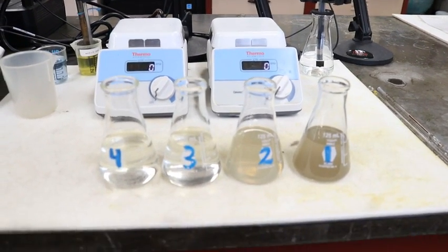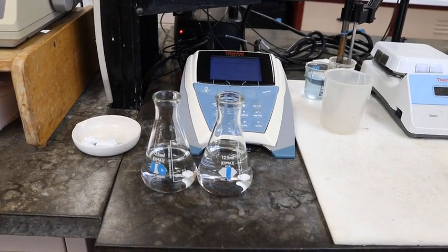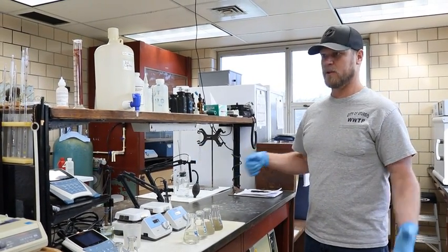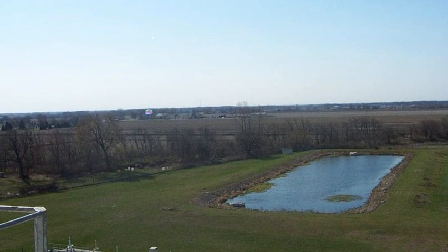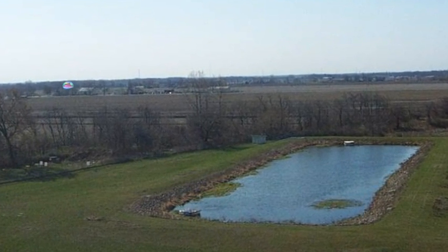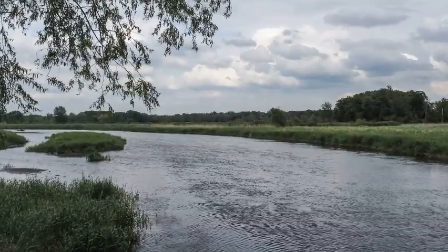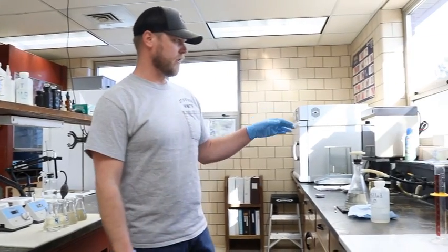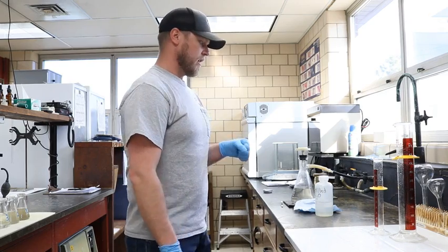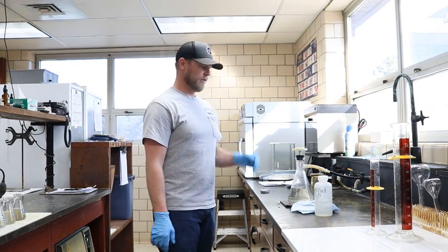In the laboratory itself, we measure pH. We have 2 meters here. We measure pH. We measure ammonia. We measure residual chlorine, which is due to us using chlorine for disinfection. We have to make sure that we are below the allowable parameter to go into the river, which is 0.038 milligrams per liter. We use this to measure our suspended solids, which I showed you on the filters earlier. We run a certain amount through, and then that helps us calculate our math to figure out our milligrams per liter.